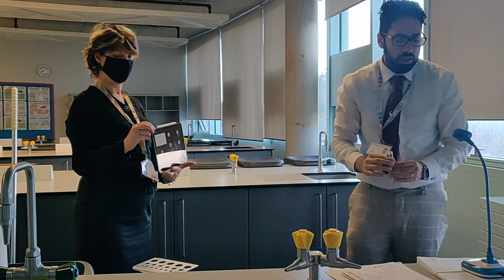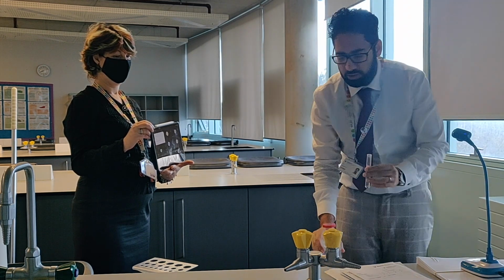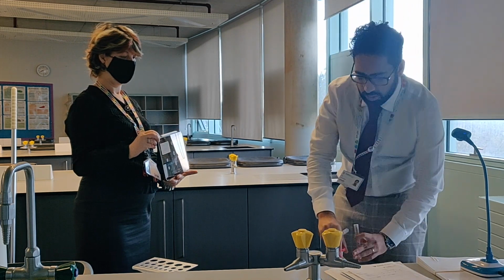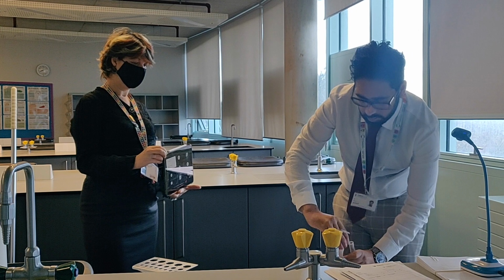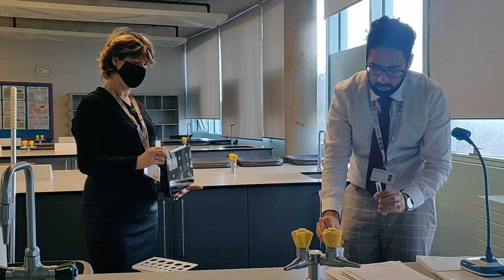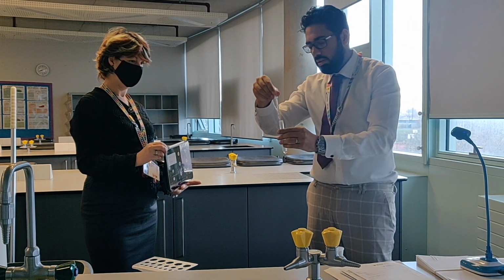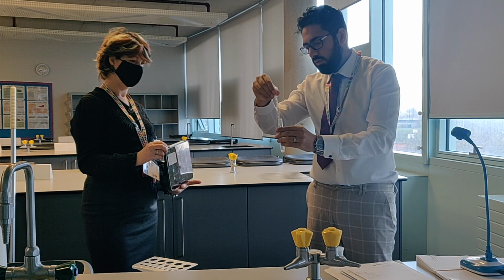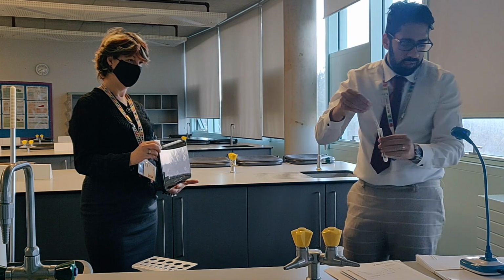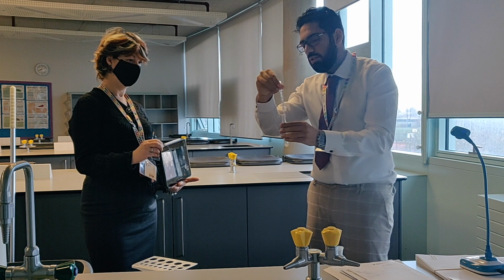And then 10 drops of sodium hydroxide solution. So my sodium hydroxide is here. Notice how I'm just using one pipette. I don't want to contaminate the solutions. So again, the same thing, 10 drops. Okay, then it says continue to add this dropwise, gently shaking until sodium hydroxide is in excess.